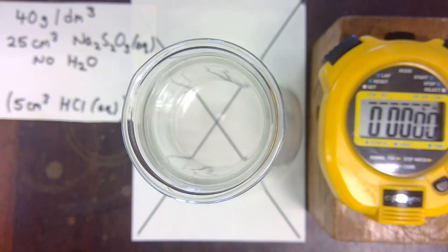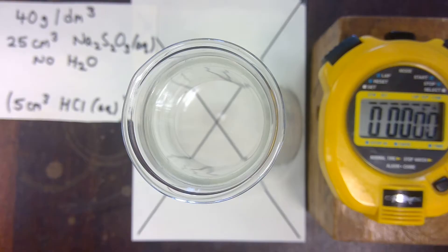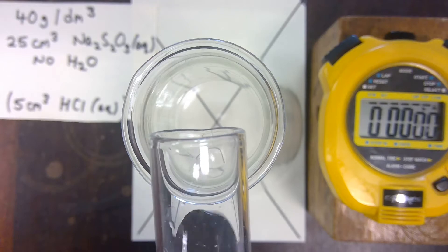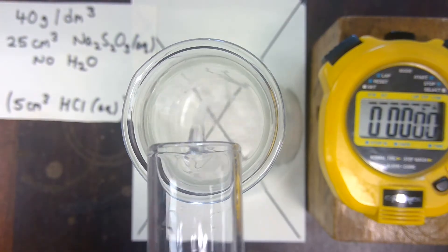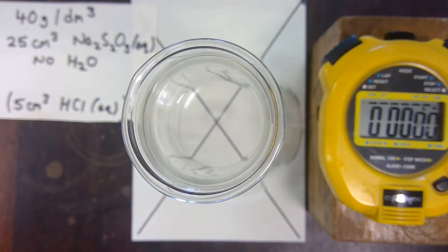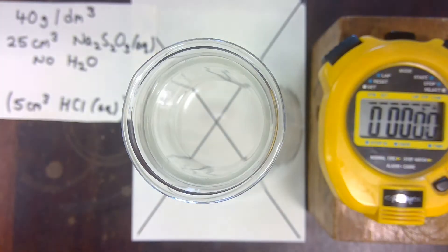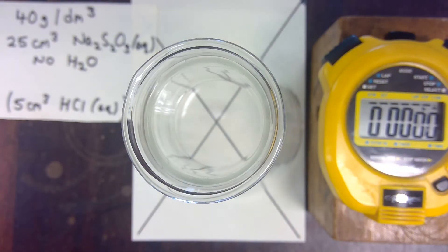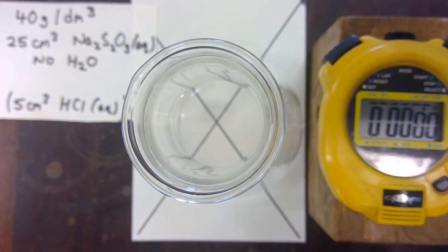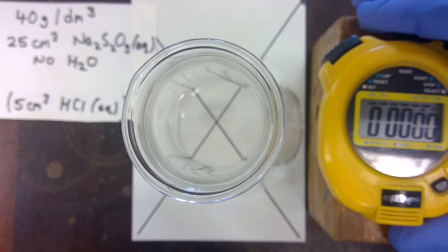The first solution we use is 40 grams per cubic decimetre of sodium thiosulfate — our most concentrated solution. I'm going to use 25 cm³ of this, measured with a measuring cylinder. I'm going to add to it 5 cm³ of dilute hydrochloric acid. I will start the stopwatch and then swirl.